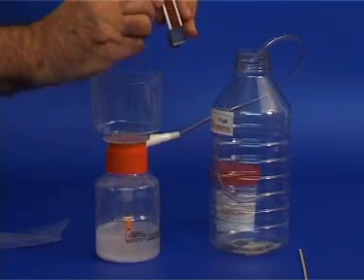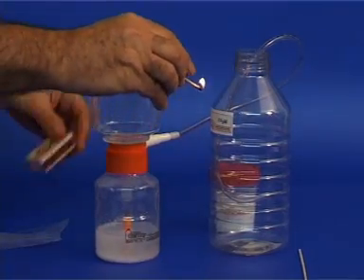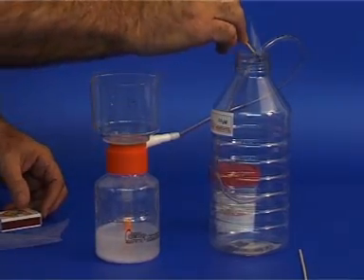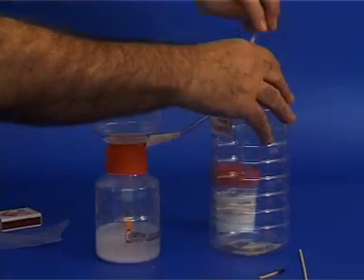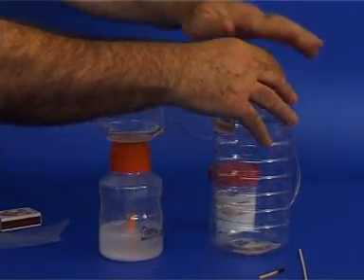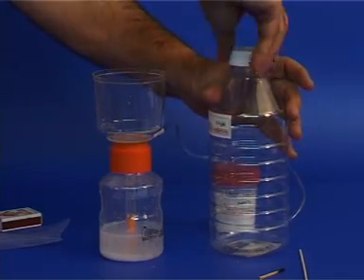Before performing this experiment, you must make sure your bottle contains carbon dioxide. To verify, light a match and hold it to the mouth of the bottle. It should extinguish. Replace the cap.